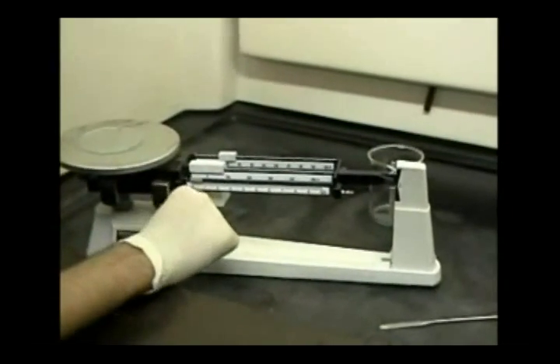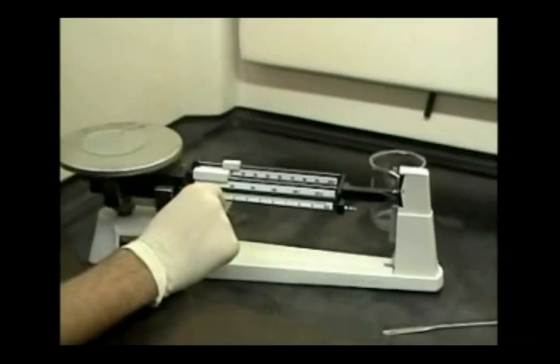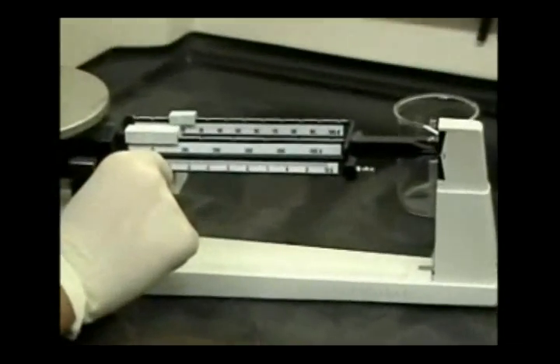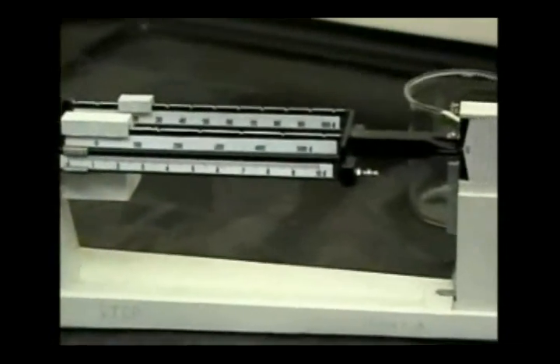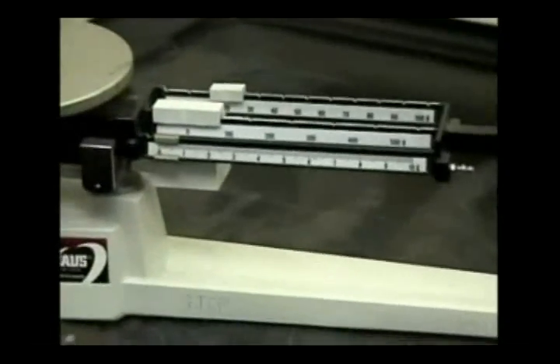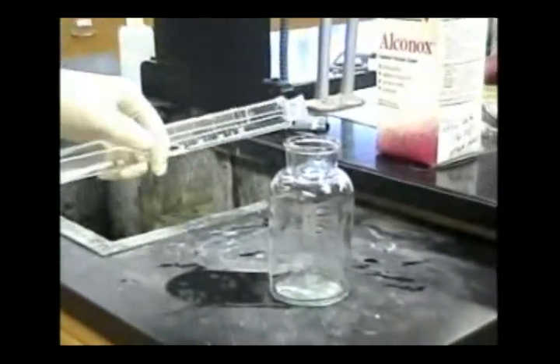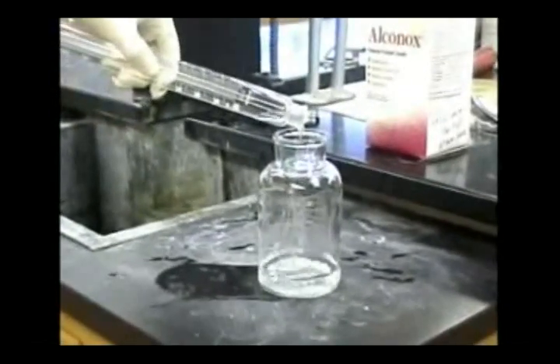The mass of the watch glass by itself is 20.3 grams. We are now pouring 50 milliliters of distilled water into the glass bottle.